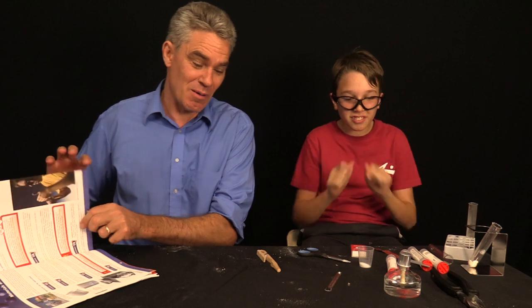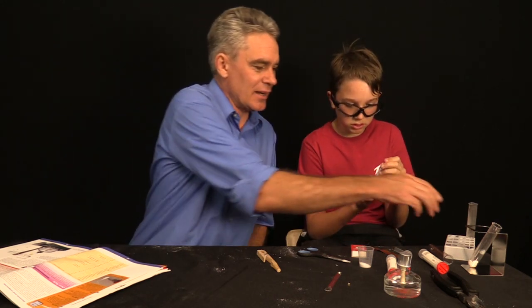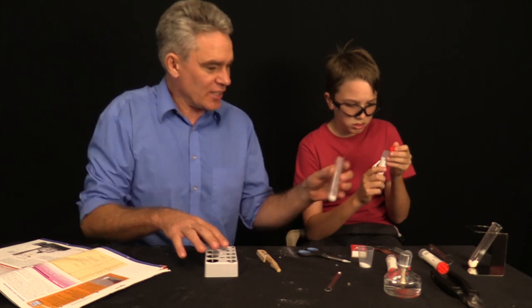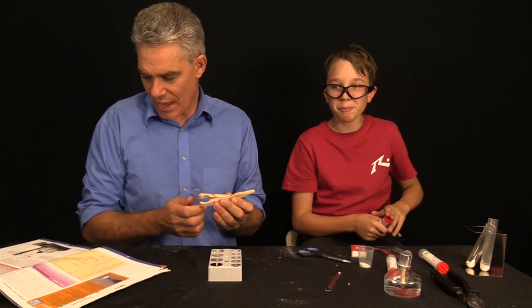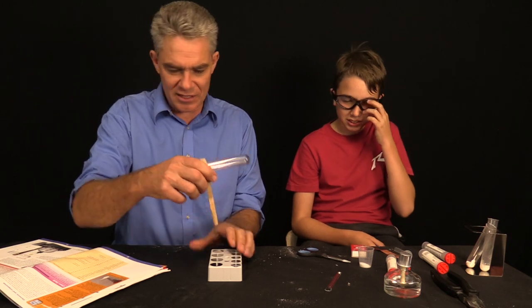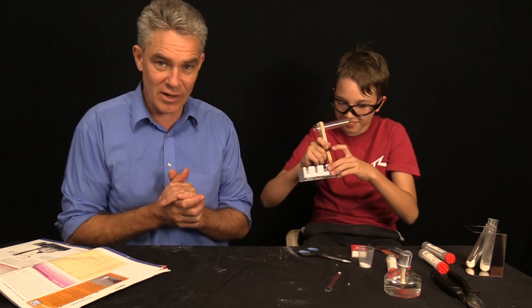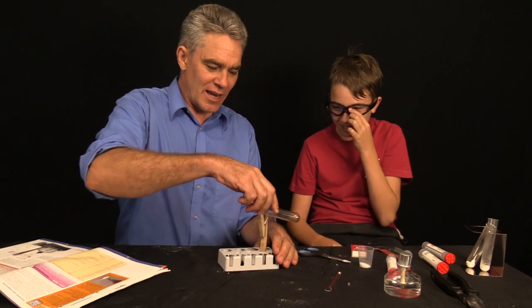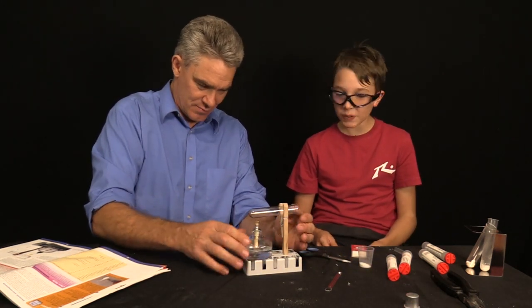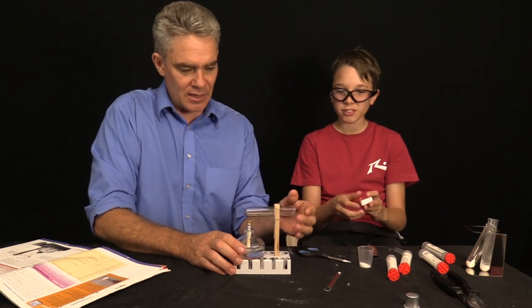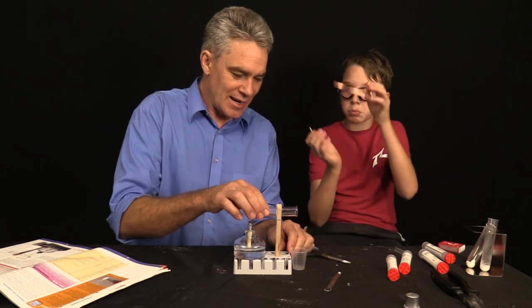I'm going to get rid of that. Then, we're up to experiment ten. This is a bit of a tricky one here. With experiment ten, we need a third test tube. So, we're cracking through the test tubes at the moment. Don't crack. We've got a test tube stand like that. Sam knows how to do it. And rotate that like so. Because the fire is apparently going to go there. I'll put the salt down there on the ground. So, this is experiment ten.